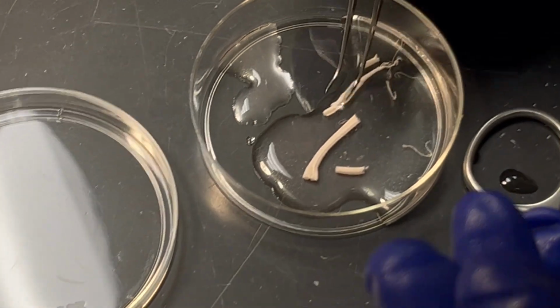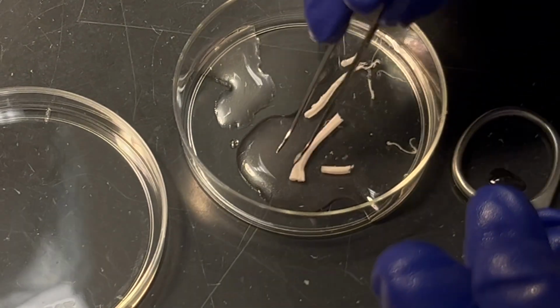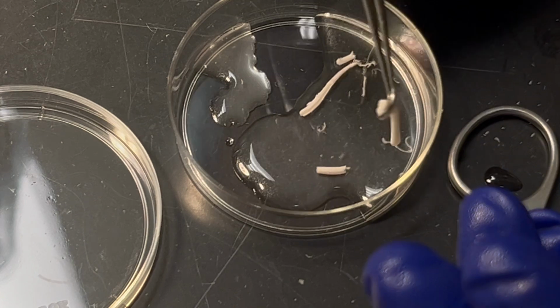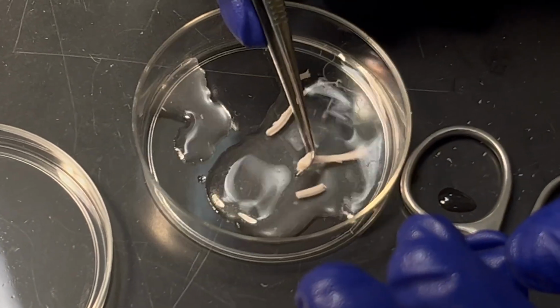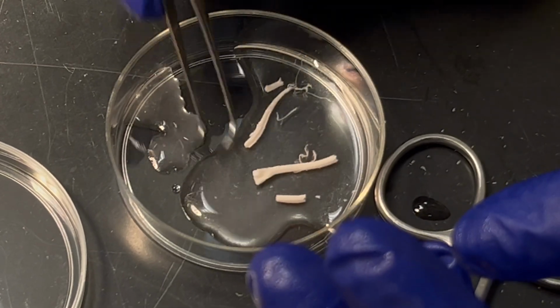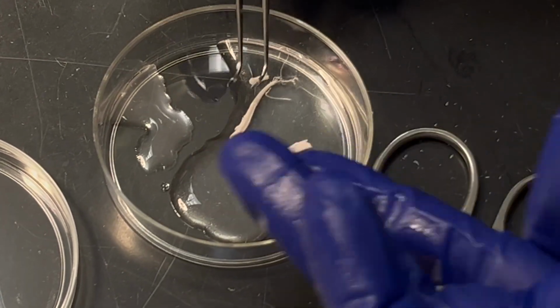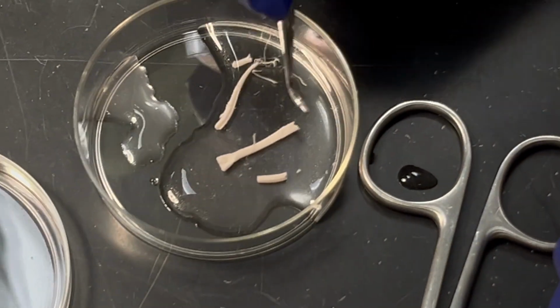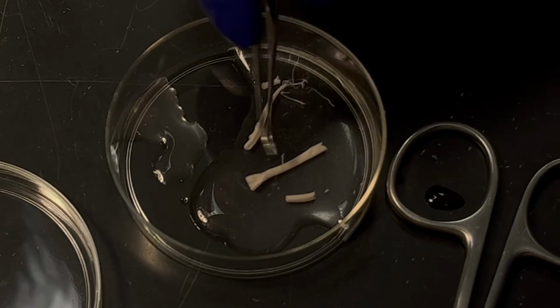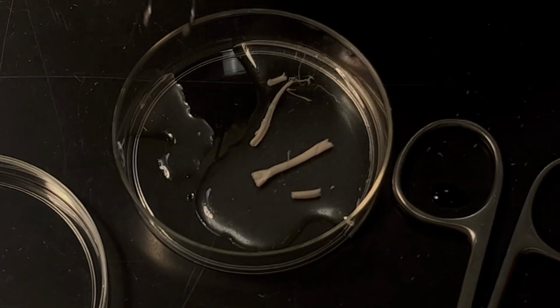So this one clearly broke, but at least I can say, for example, if I lift it, you'll see the ventral looks very different, right? Yeah, it's very plain, very wide. So even if it's out of the body, you can always orient yourself. This is ventral, and then the other side is dorsal.